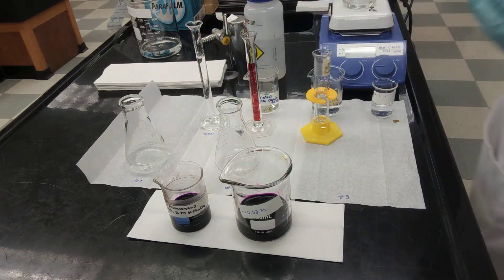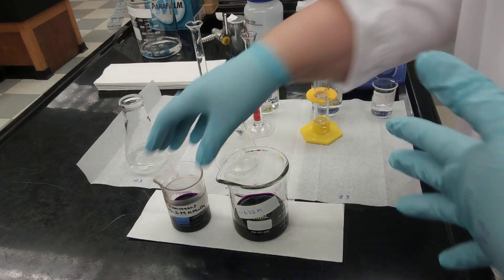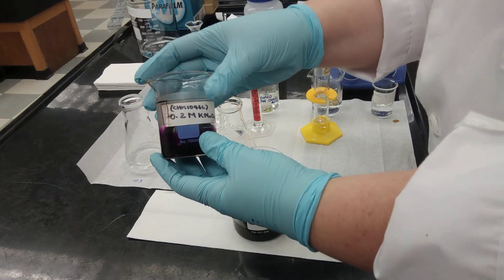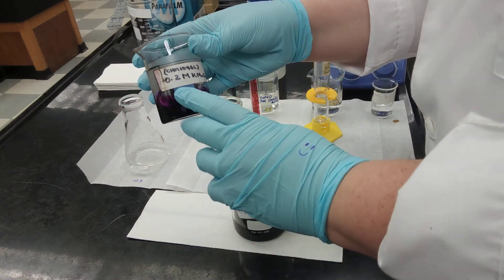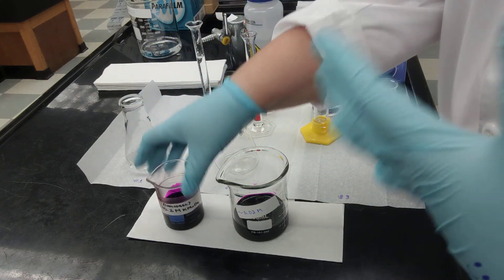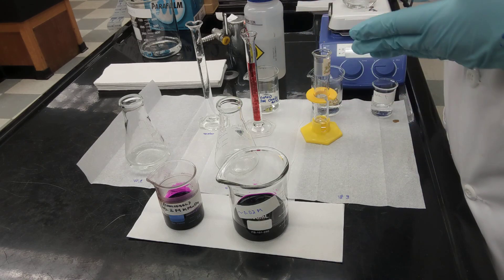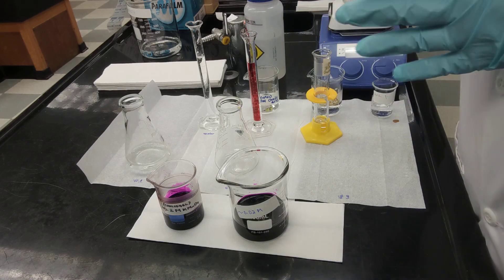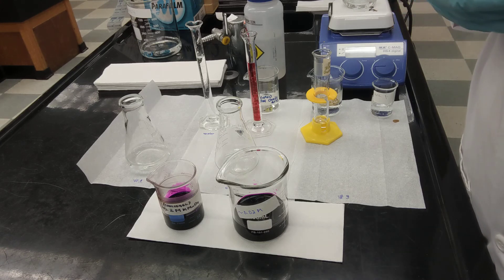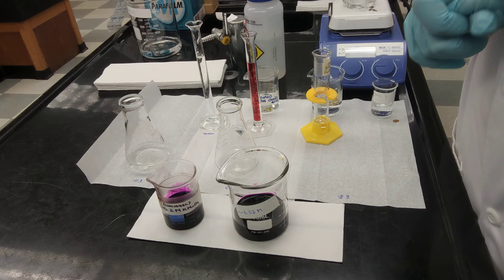The first thing you're supposed to do in this experiment is to prepare a dilution of potassium permanganate. The original solution has a concentration equal to 0.2 molar. What you need to prepare is a dilution with a final concentration equal to 0.02 molar, and you need a final volume equal to 100 milliliters.